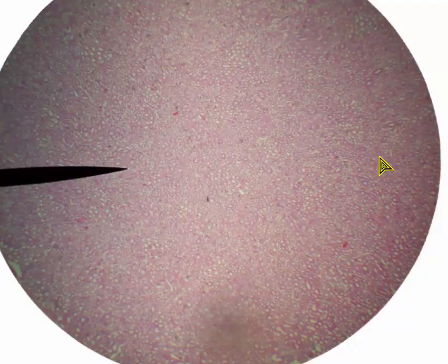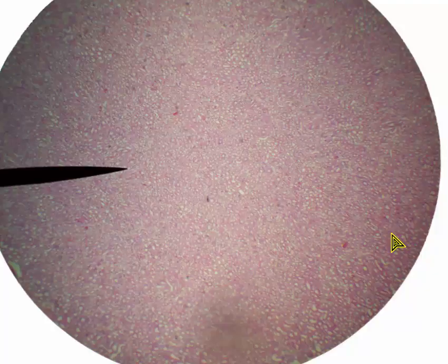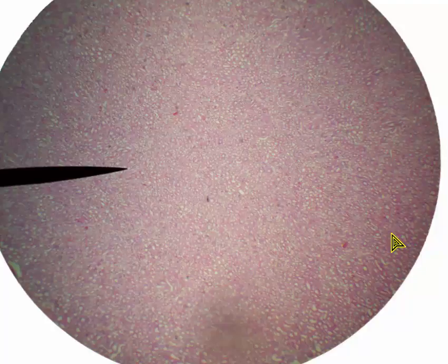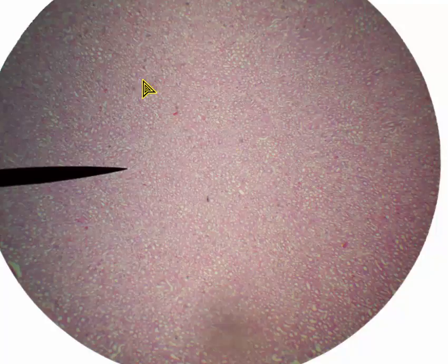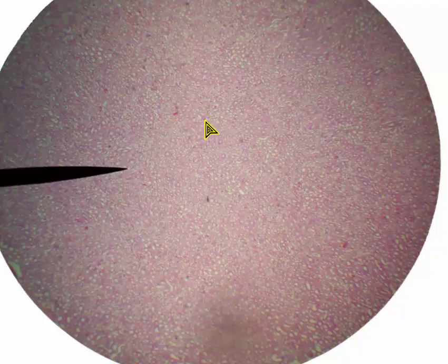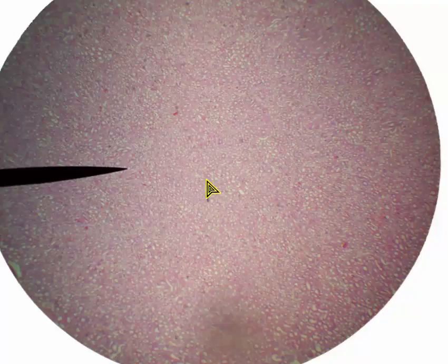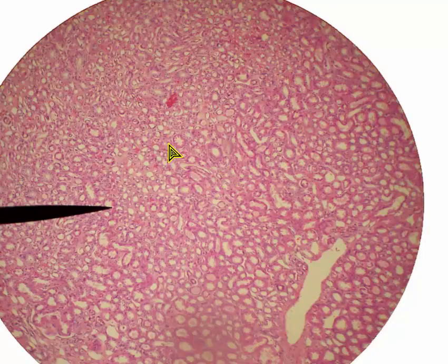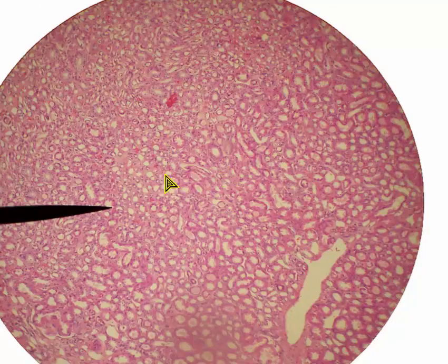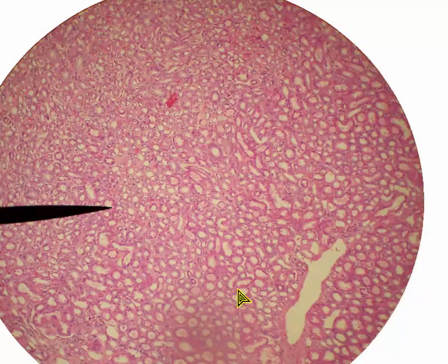Moving on to the next image, we're back down to low magnification, and we are no longer in the cortex. We're now in the medullary region or the medulla of the kidney. I say that because there are no renal corpuscles in view, even at this low magnification. All we see are tons of tubules. At 100 times magnification, we again see lots of tubules.